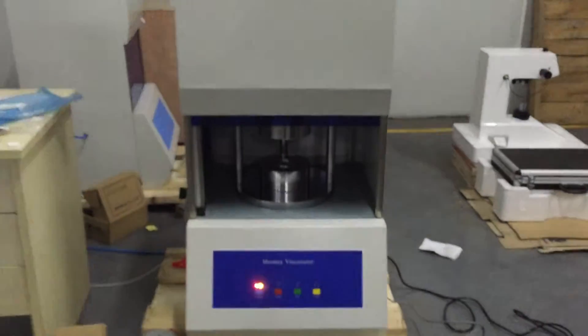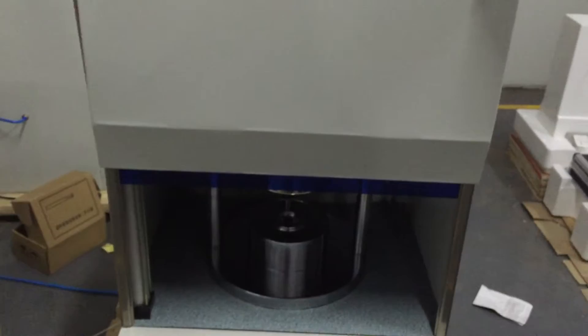First, we will enter the front side of the machine. This is the whole host of the machine.